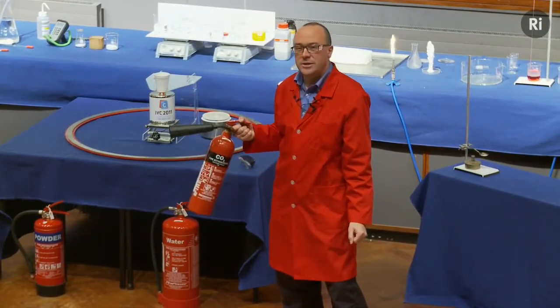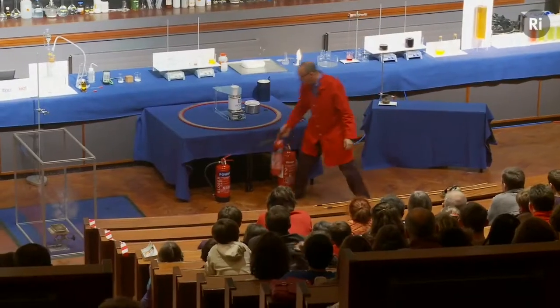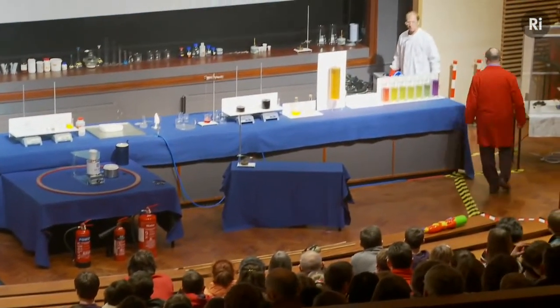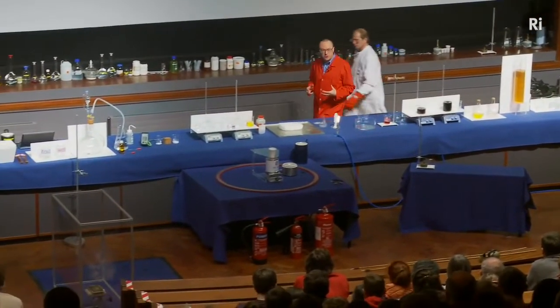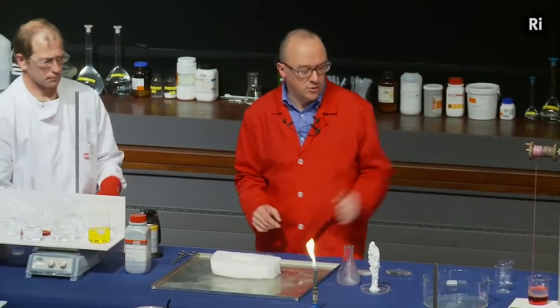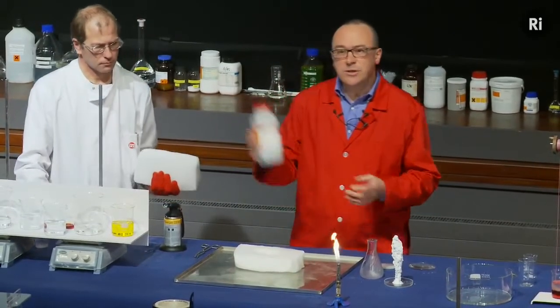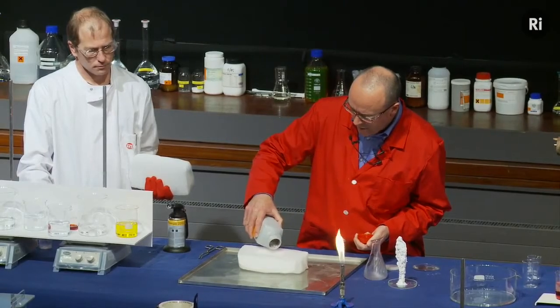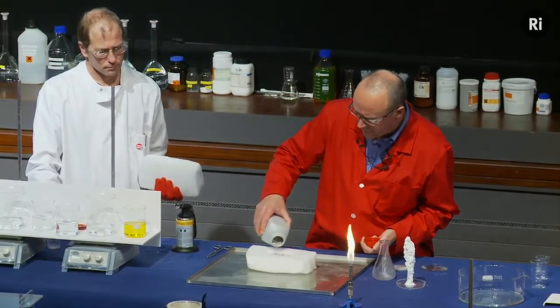So it'd be a bit odd if using a fire extinguisher like this would actually make the fire worse rather than better. Well, let's see what that might look like. So again, we're going to use carbon dioxide in a very concentrated form, in the form of solid carbon dioxide or dry ice, which is something that we saw a little bit earlier in the lecture. So this is a block of dry ice, and again we're going to use magnesium. So I have some magnesium metal here, and I'm just going to make a little pile in a little trough that we've cut inside the block.